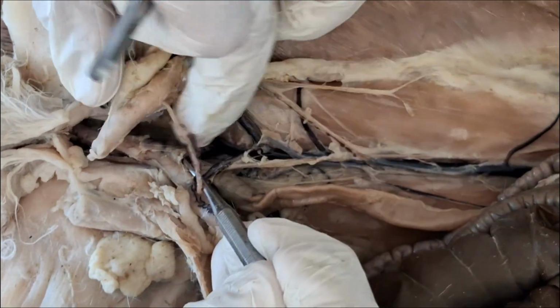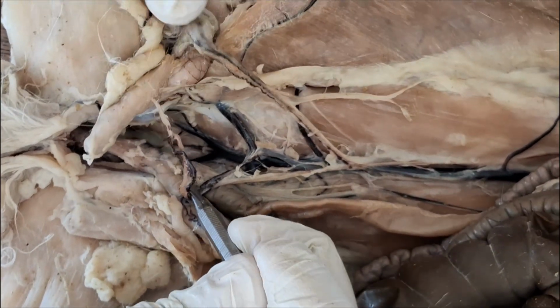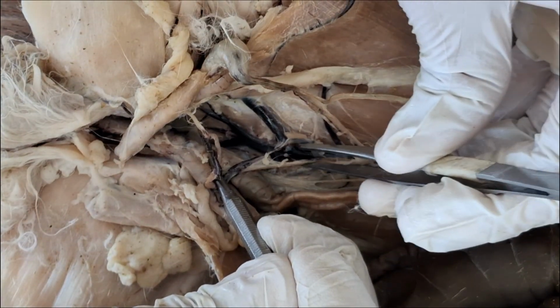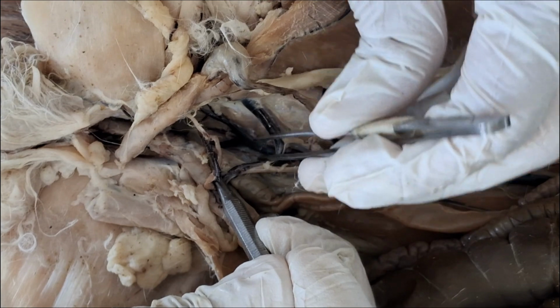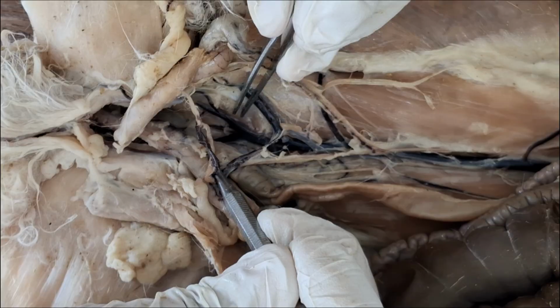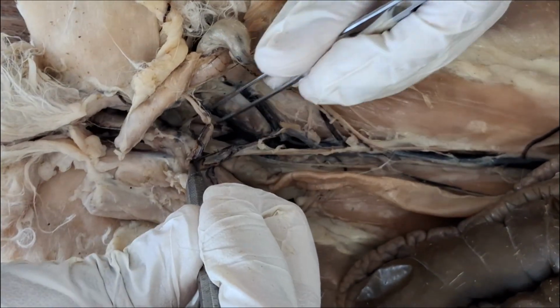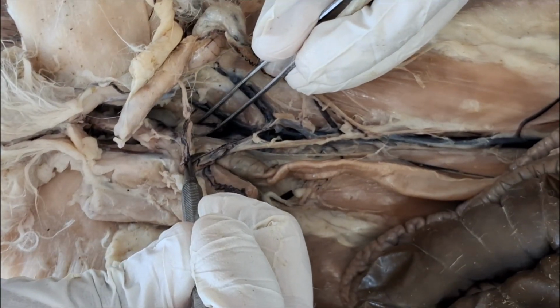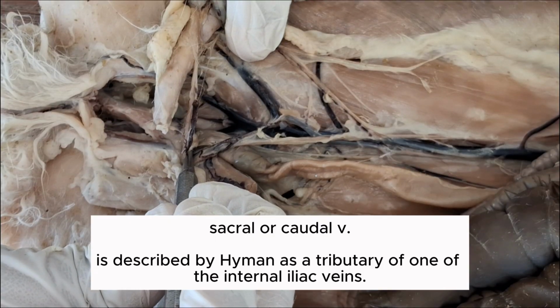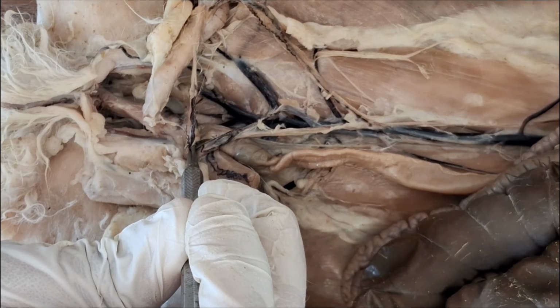So you have to look for them deep behind the rectum and the bladder. So there's two splits: postcava, external iliac, common internal iliac, and then there's the internal iliac. And then what remains of the postcava, that slender black vein there draining the tail, is the median sacral or caudal vein. There, caudal vein.